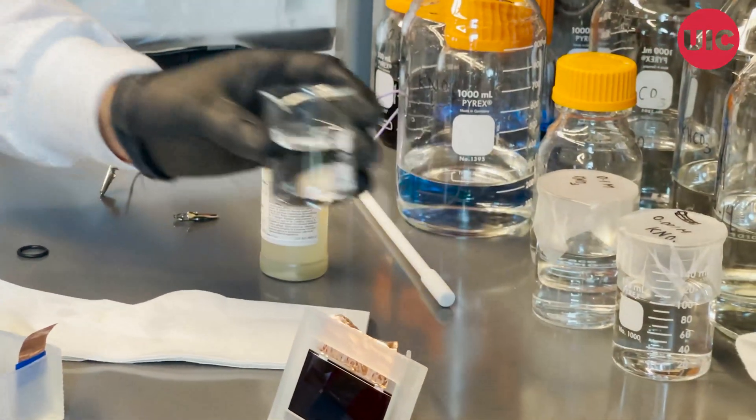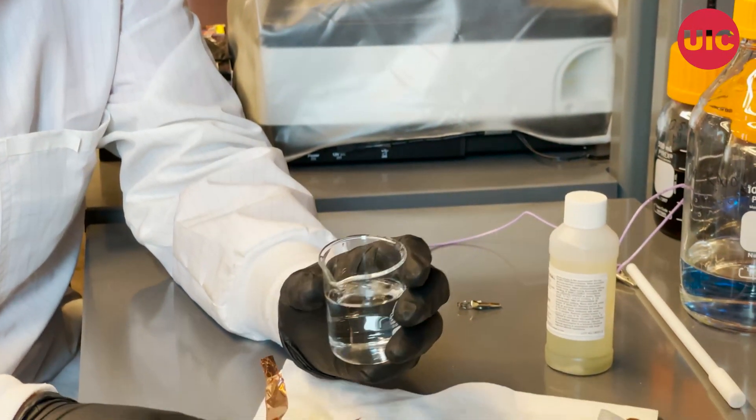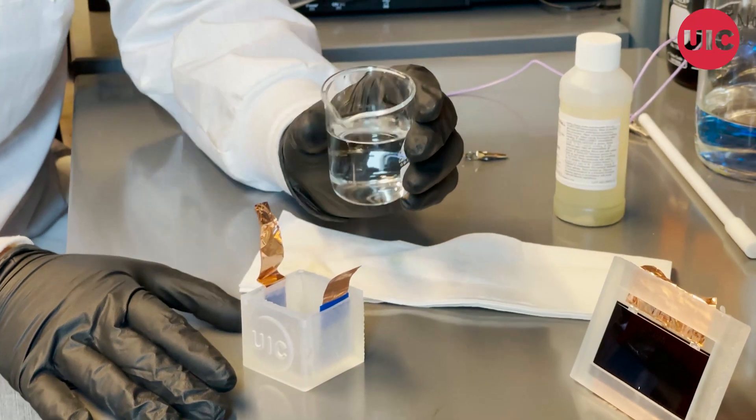Now we'll be pouring in the electrolyte for this reaction, which is one molar potassium nitrate and one molar potassium hydroxide.